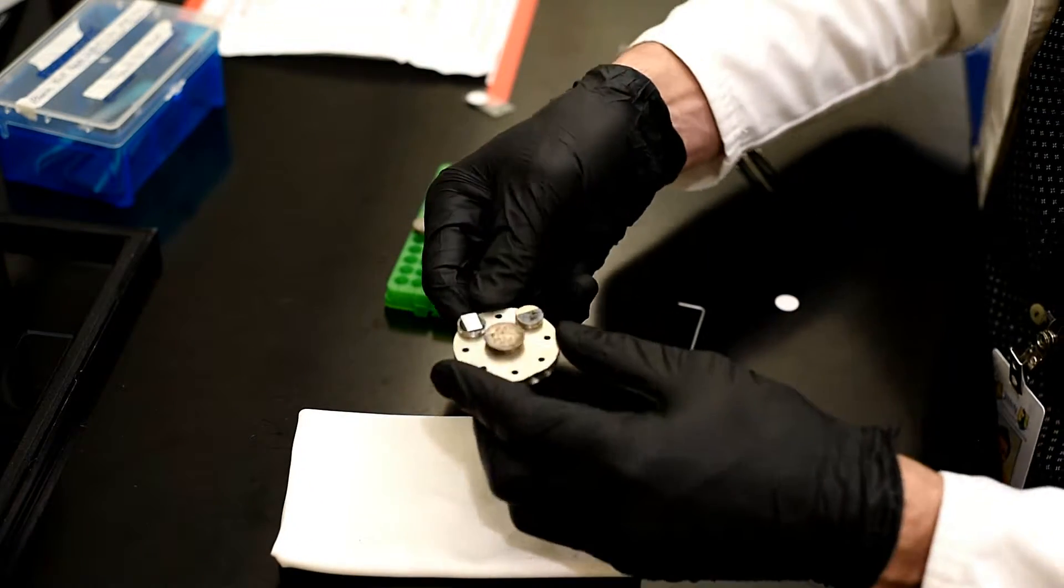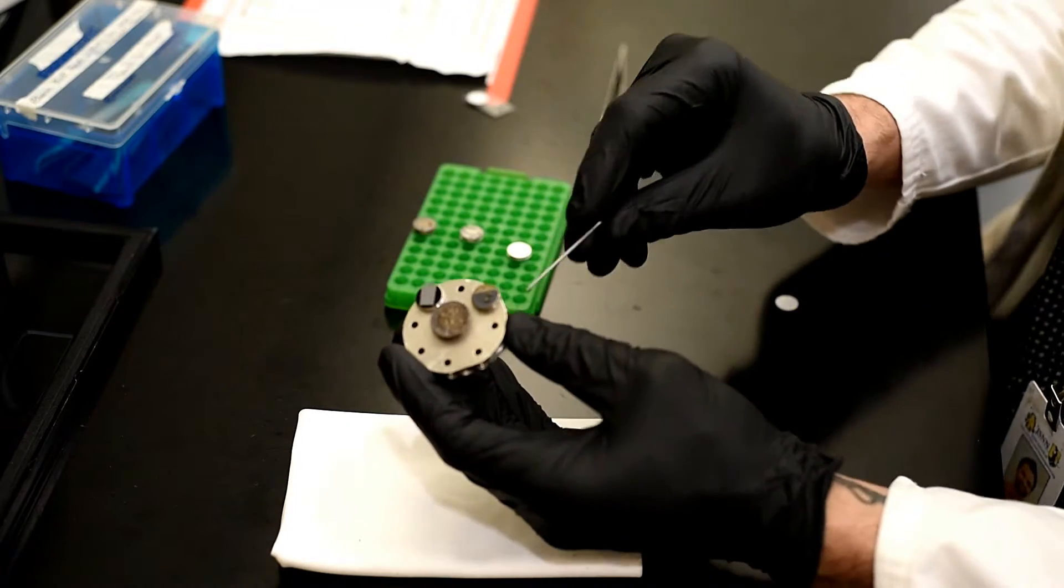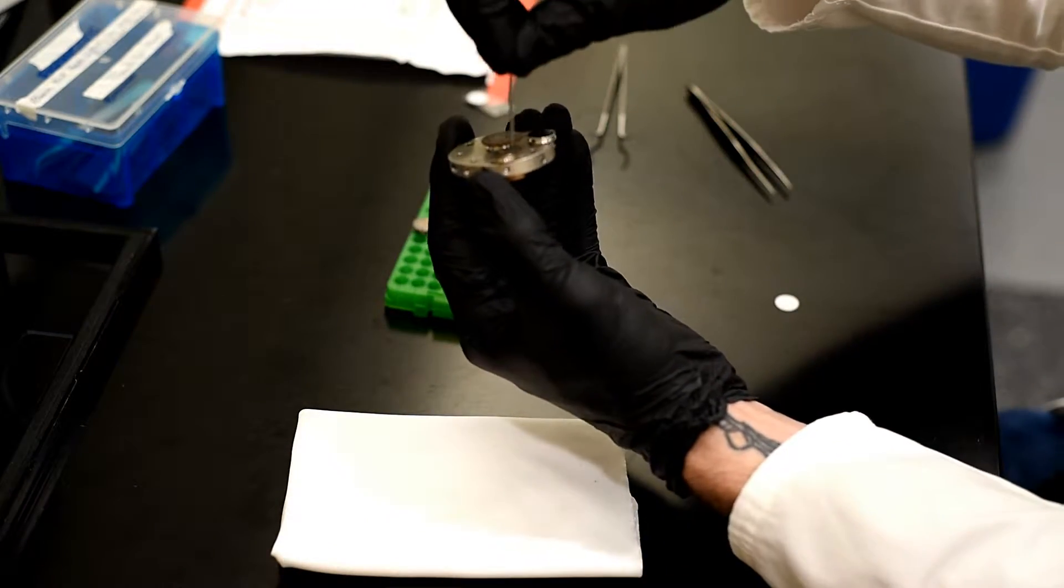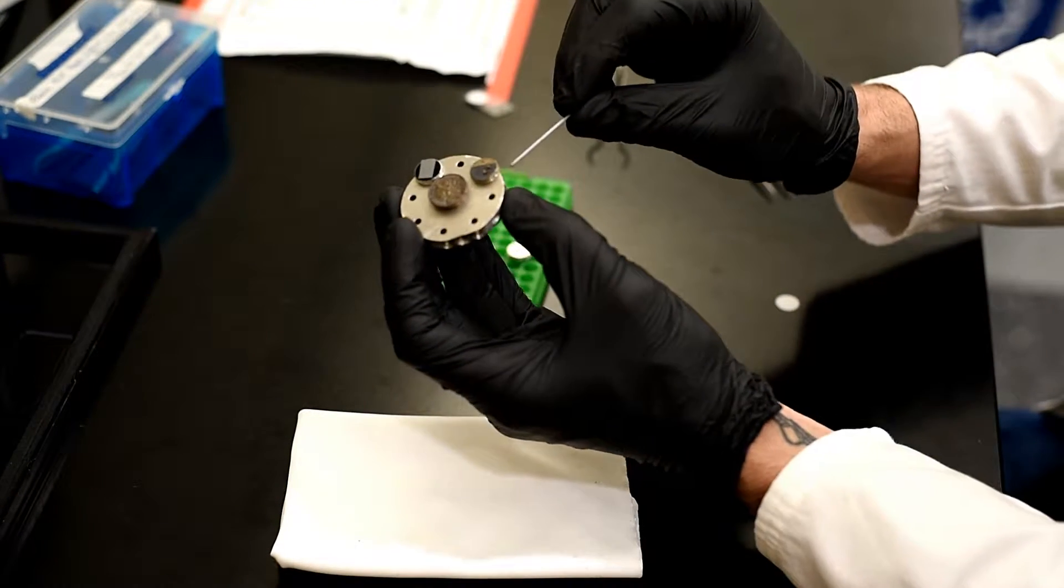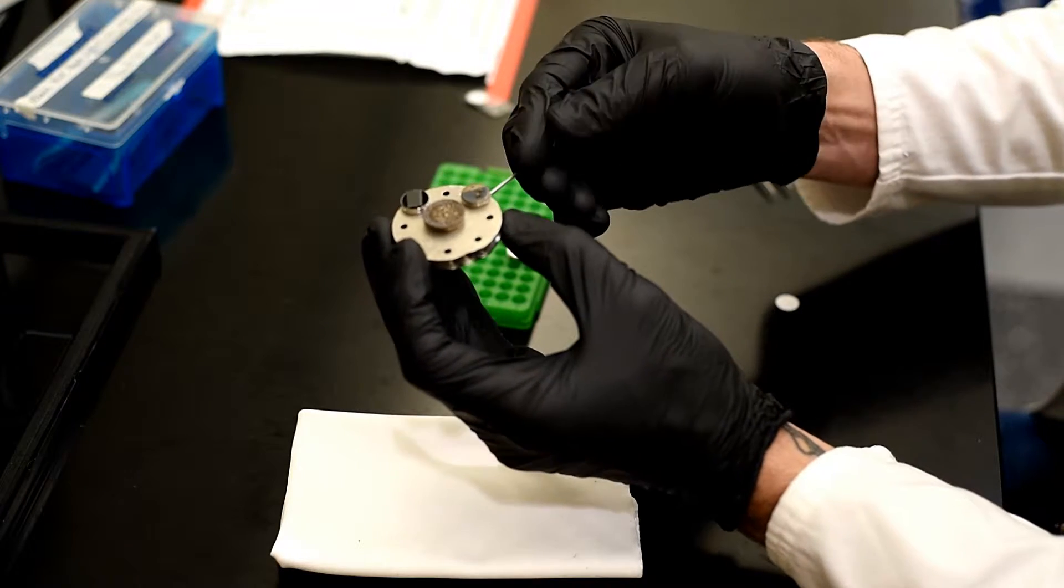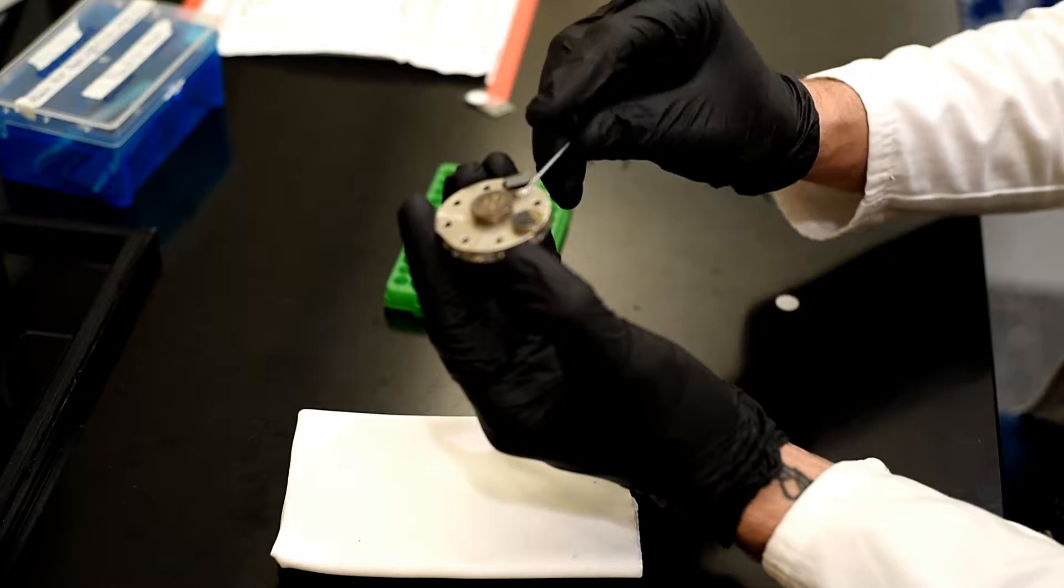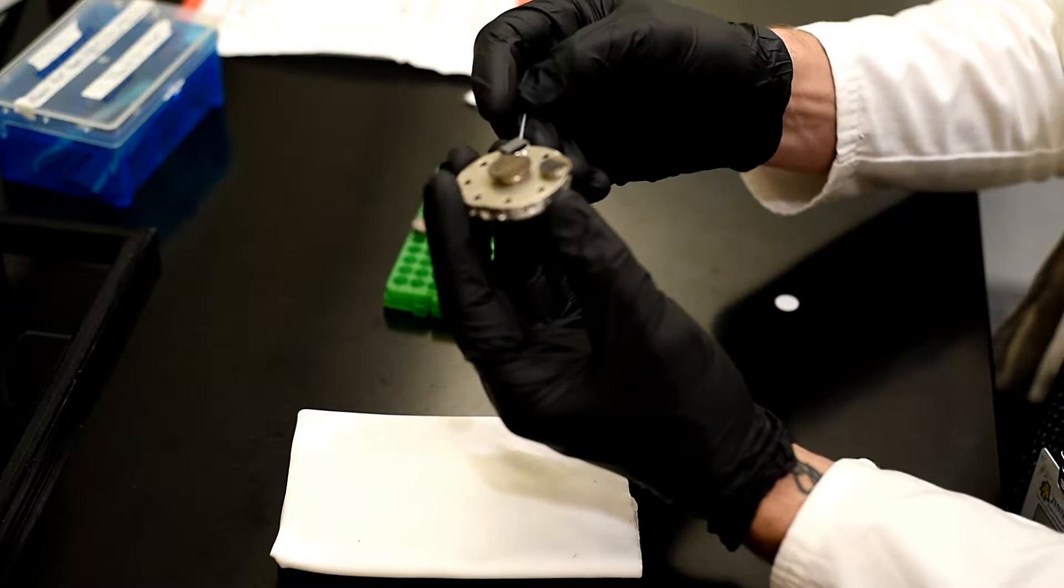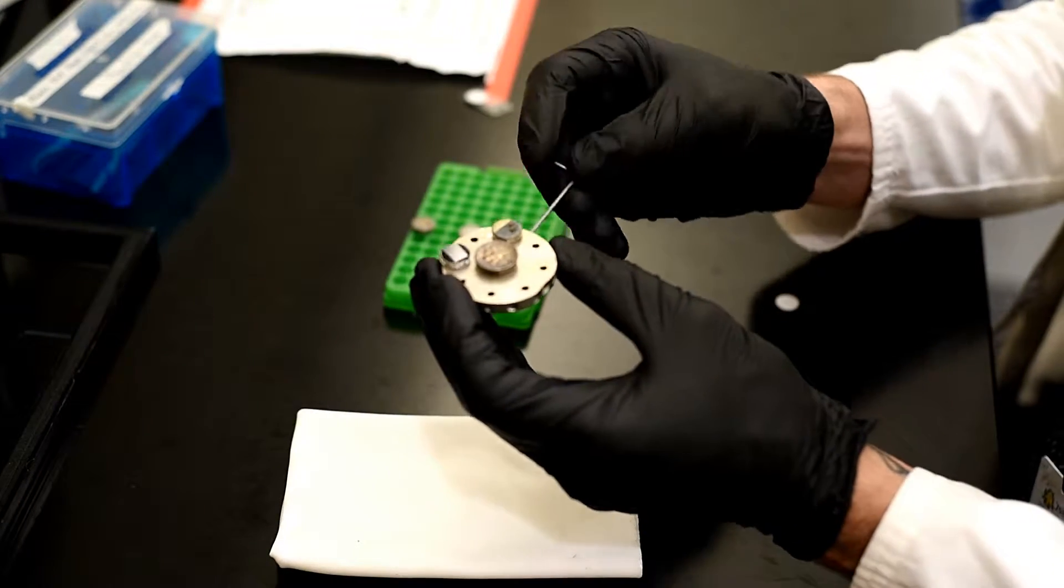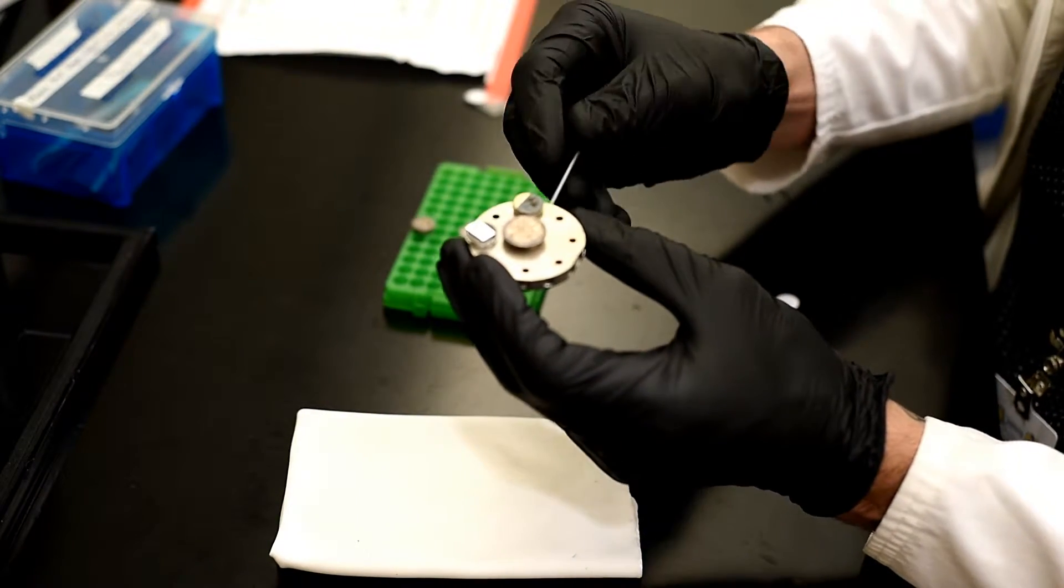So once we've put those samples in, on the edge of each one is an Allen screw. So you can see here for the fruit fly that there's an Allen screw that you can tighten with this. So just a few rounds for each sample. And then I typically just turn the sample holder upside down to make sure that they are actually in place.